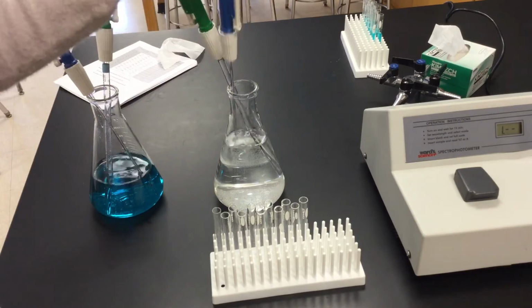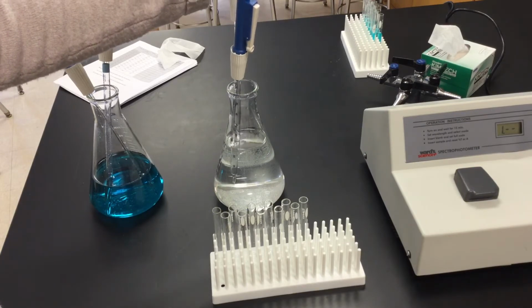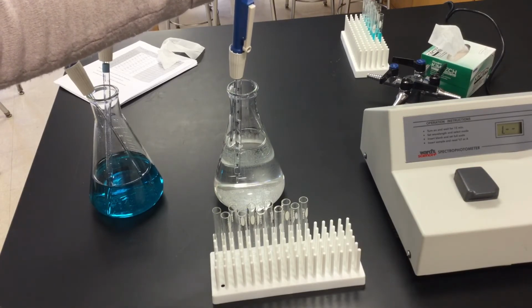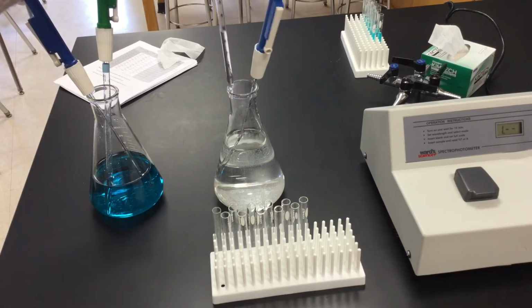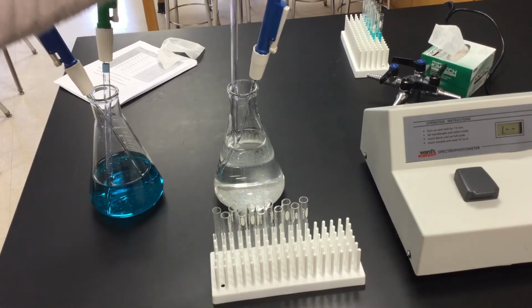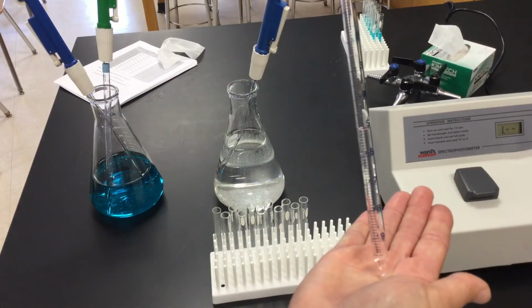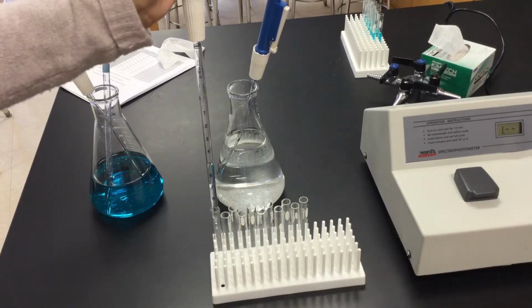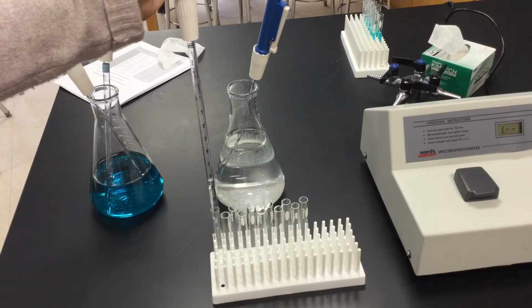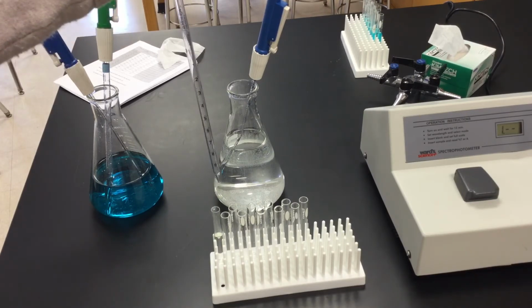I'm going to use my 10 ml pie pump. This is much easier if you're sitting down and having it at eye level. I'm going to go to my 5 mark on this, and I want to keep them all identical. That should also be a constant. So as I go through, I'm measuring my 5 ml mark. I'm going to put it into my first tube, slowly release all the way down, and I'm putting those 5 mLs into that particular tube.